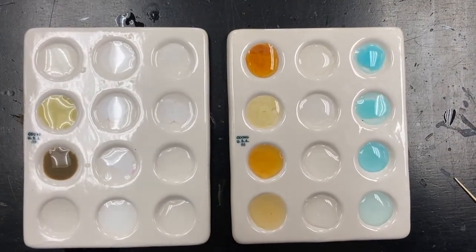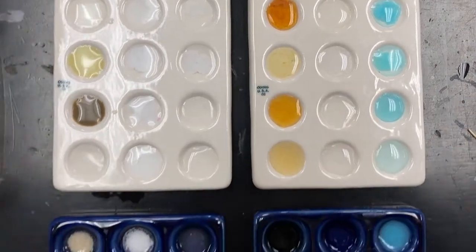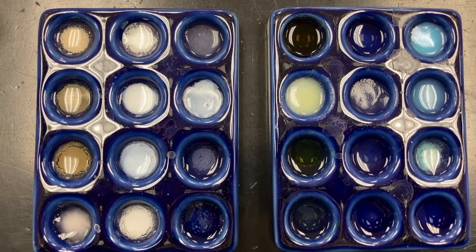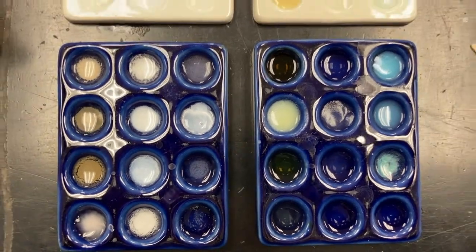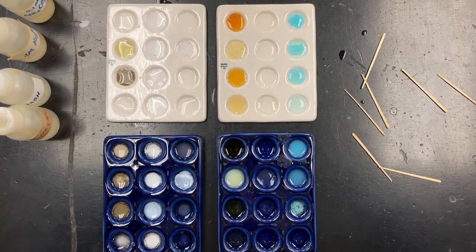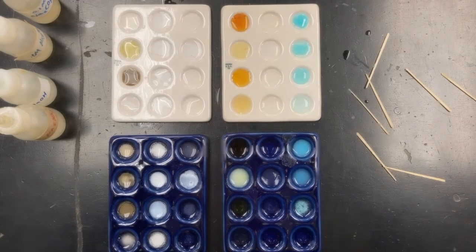So those are the overall colors with a white background. And then right below them, those are the overall colors with a blue background. And here they are together. Okay, so hopefully you have enough information now, and you can pause the video and go back and look if you need to comment on whether there was a precipitate or not, and if there was, what color it was and what consistency it might have been, whether it was flaky or little tiny grains or milky or cloudy. That should all be included in your data table.